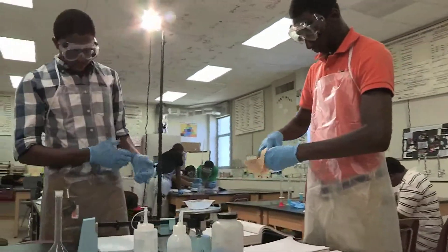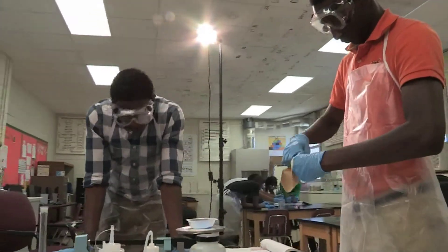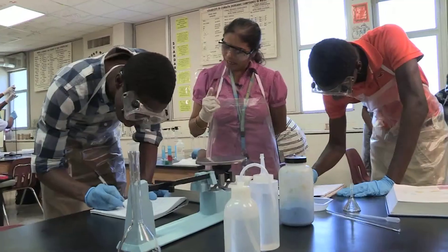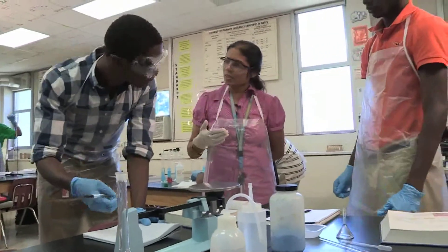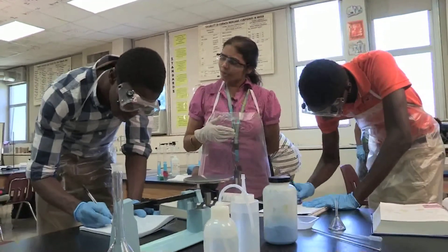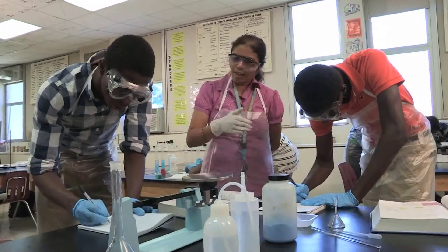I want you guys to fill in your data table. Basically, I was mixing a solute and solvent and making one solution — it's basically like baking a cake, using milk and flour and just making it all into one mixture. From moles, you go backwards and get how much you need to start.